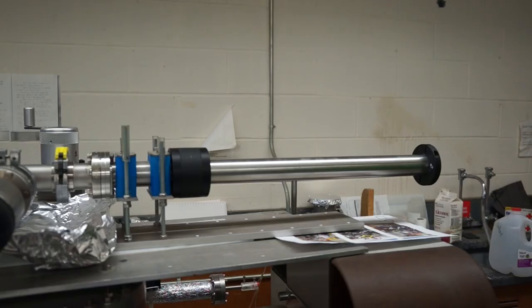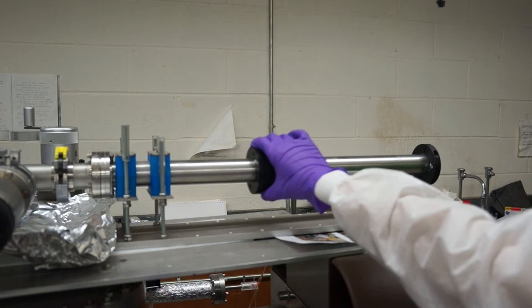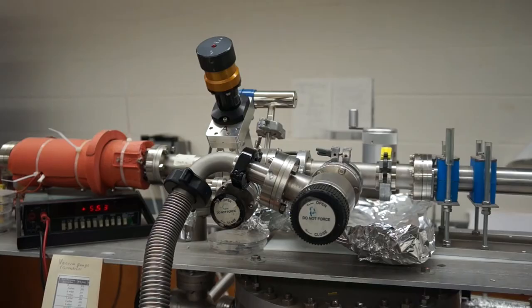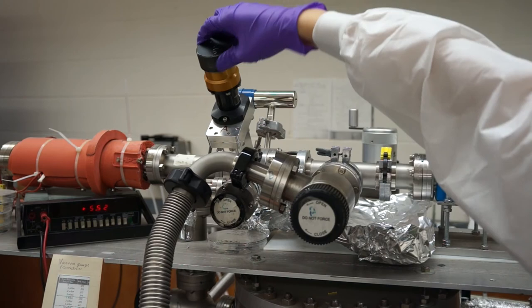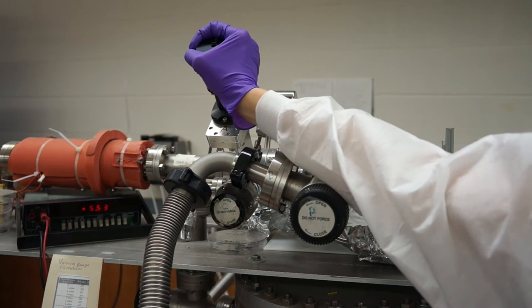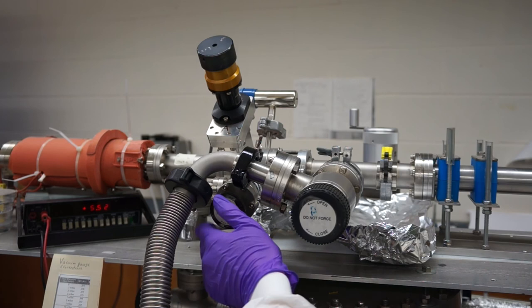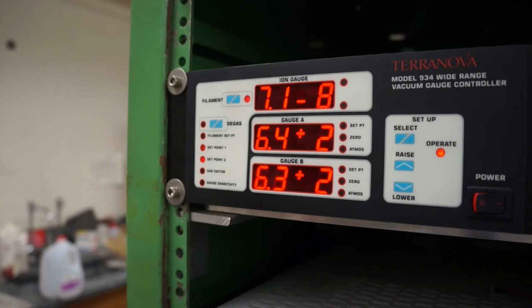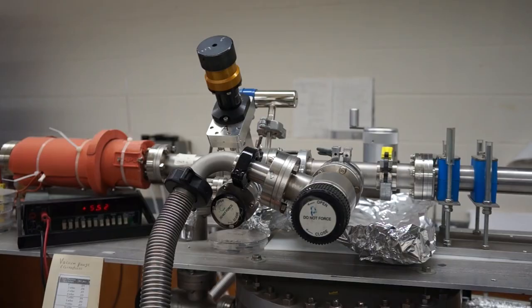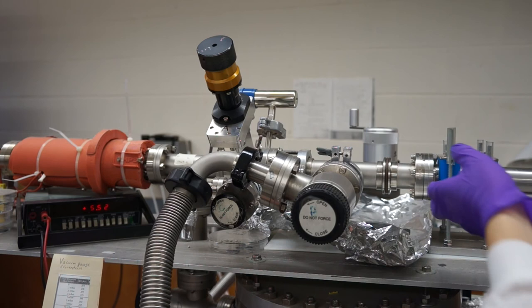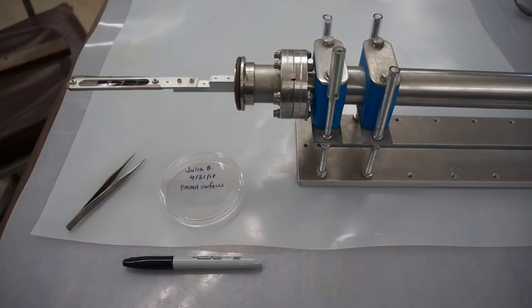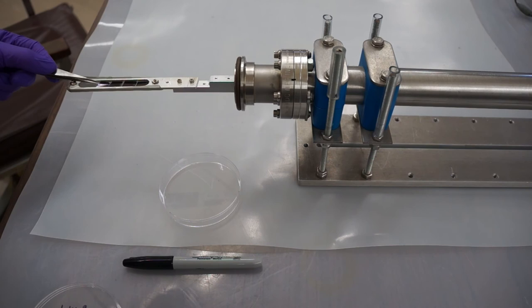The next day, begin taking out the samples by sliding the magnet out to the right. Remember to keep the white mark steady. Close gate valve A entirely. This provides a good deal of resistance, so make sure that it is really closed. At the same time, you shouldn't force it beyond where it stops, so be careful. Then open valve C. You'll hear a little hissing when the sample line vacuum is released. When opening valve C, it is crucial to look at the ion gauge to make sure it doesn't jump past the 10-7 torr range. Open up the yellow flange clamp and take the sample holder out of the line and onto the table. Now you can carefully take out your annealed samples and put them into their petri dish. Add annealed and the date taken out of the oven to the label so that you can keep track of your samples.